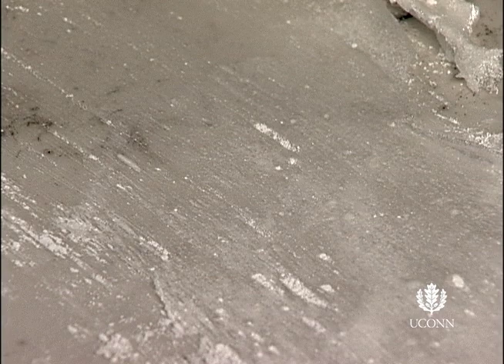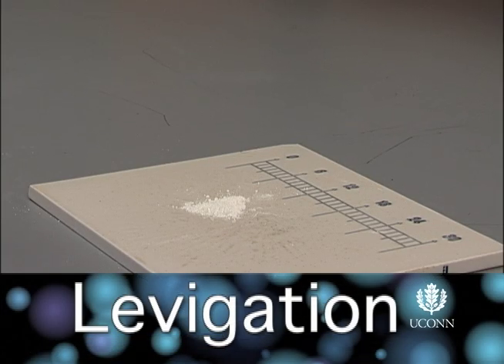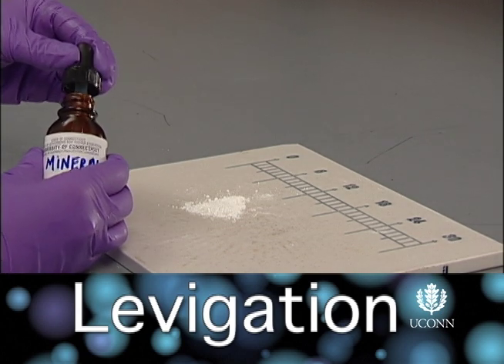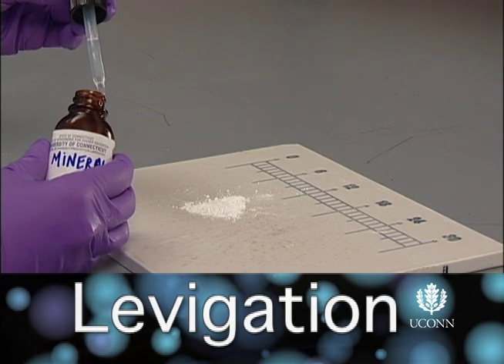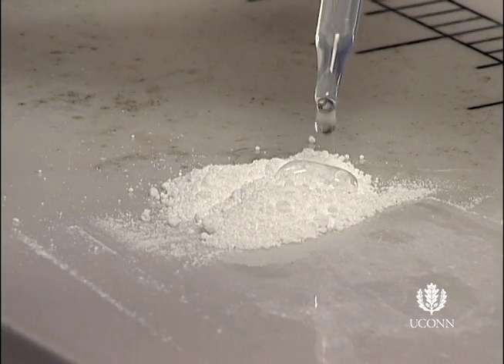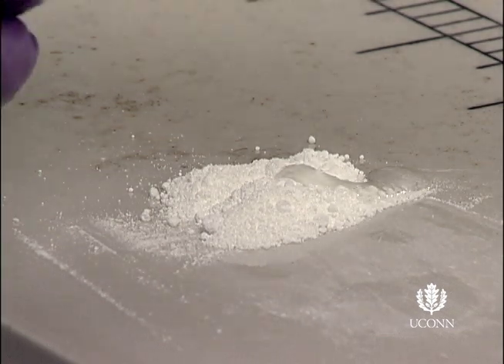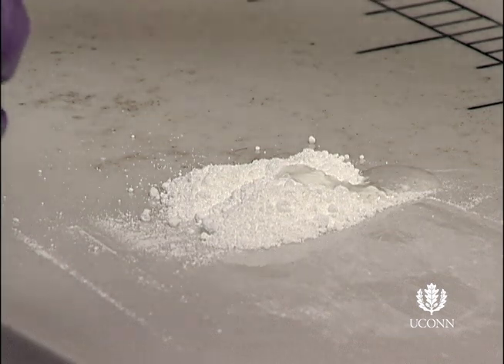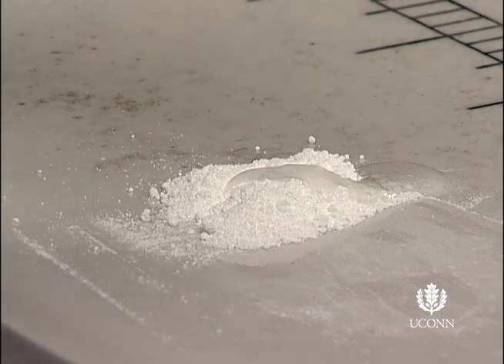Incorporation of a levigating agent may prove useful. Levigation is the process of reducing particle size of a powder and reducing agglomerates of particles for more even distribution. This is accomplished by levigating the solid with a small amount of liquid. The liquid that is used is referred to as a levigating agent. This liquid is typically somewhat viscous and has low surface tension to improve wetting of the solid.